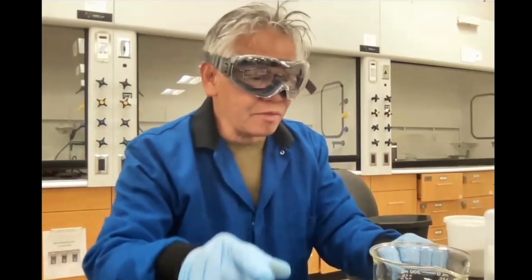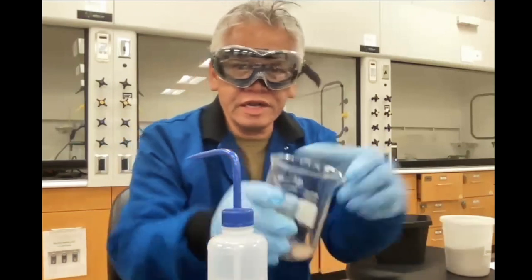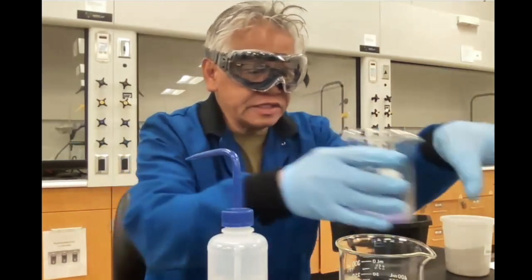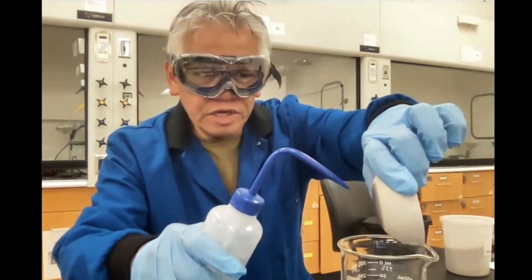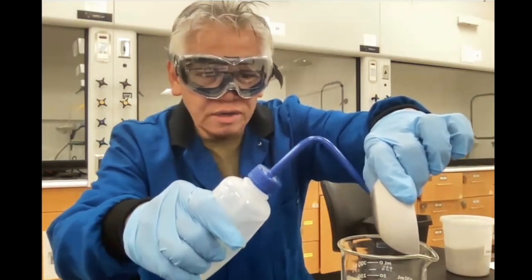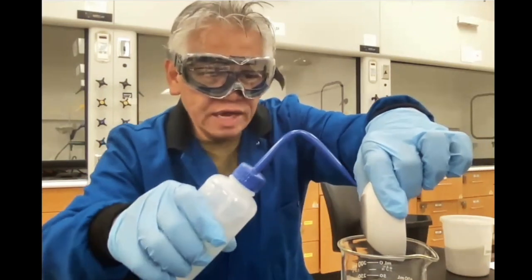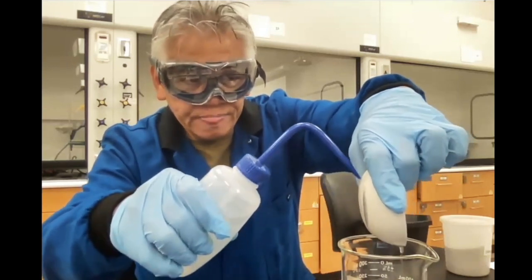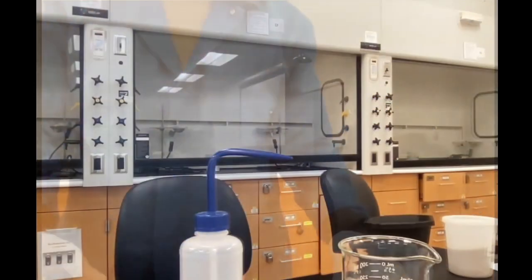We clean up with the regular water. Yeah, clean up with regular. What you want to do is just take this, put water, swirl it around, put it in your waste container. Swirl this around, put it in your waste container. This one, let me show you how you would do this. Just take this, put it over a beaker, and then just wash it down with water. It'll wash down easily. And then just take a paper towel and then wipe it dry. Same thing for the beakers.